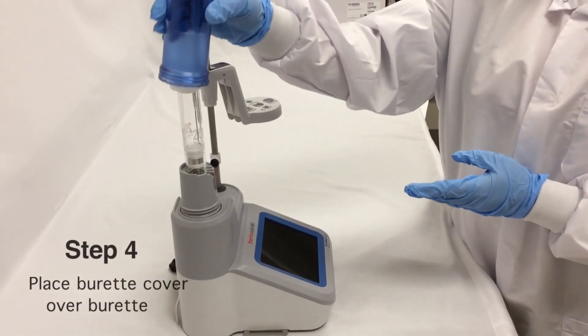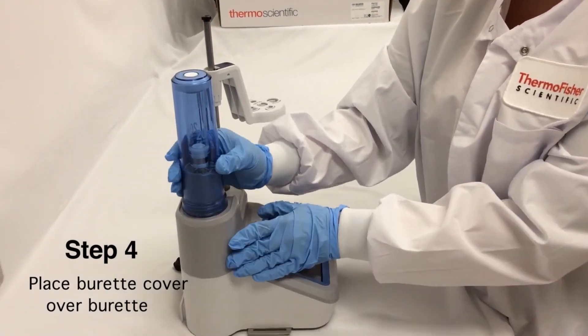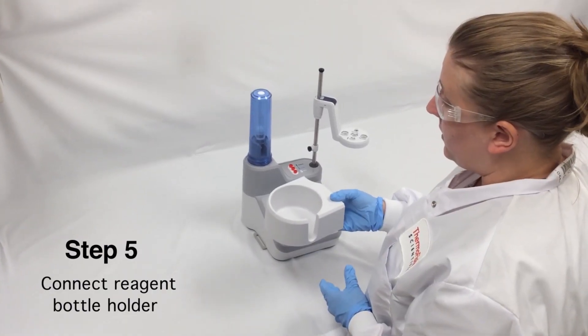Put on the burette cover and install the reagent bottle holder.